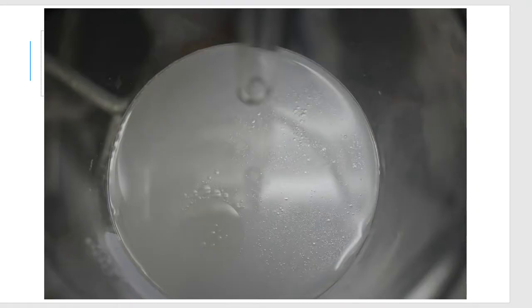If I took a picture of the surface of the distillate, you can clearly see bubbles on the surface of the water layer — all over the place. That is your organic clove oil. With this process you get the majority of water, and clove oil will be part of that — but extremely tiny amounts. This is the problem with essential oils. That's why they're so expensive — you get very little oil from these products.